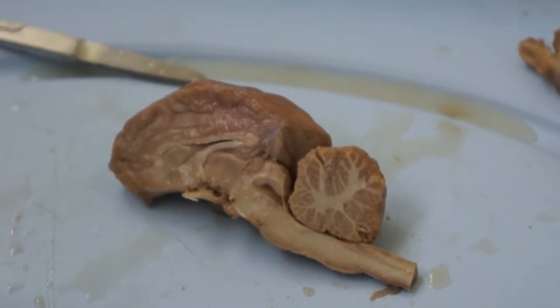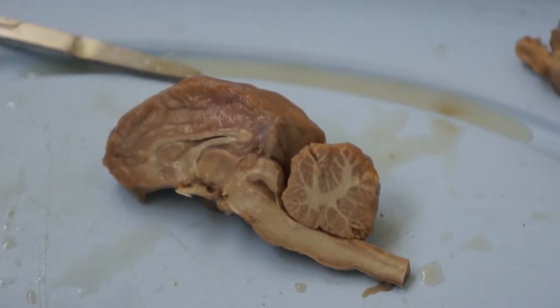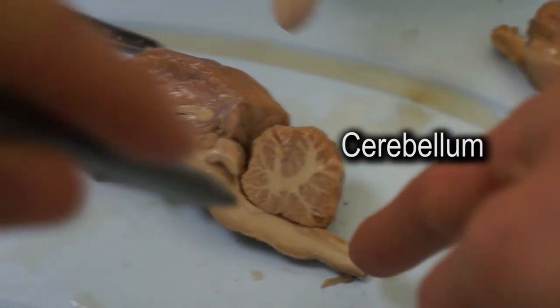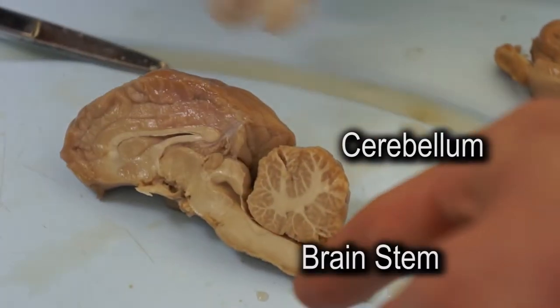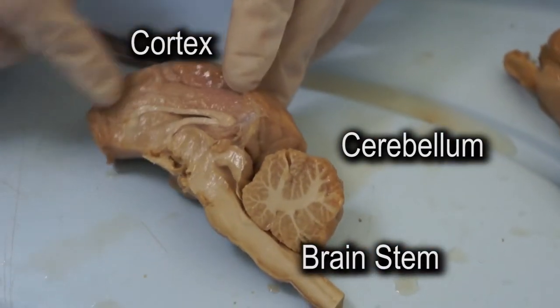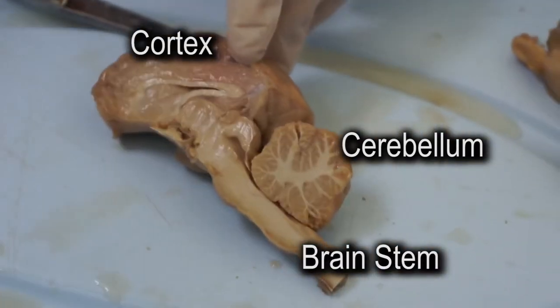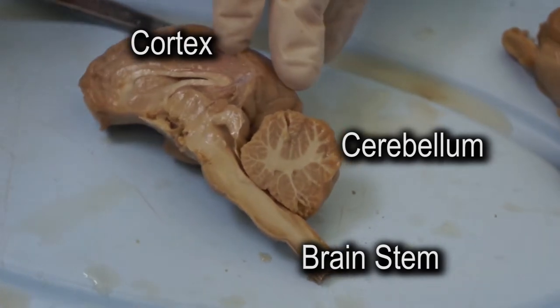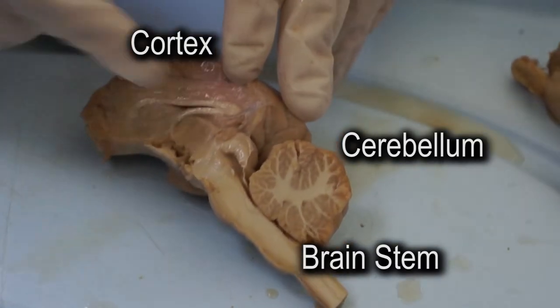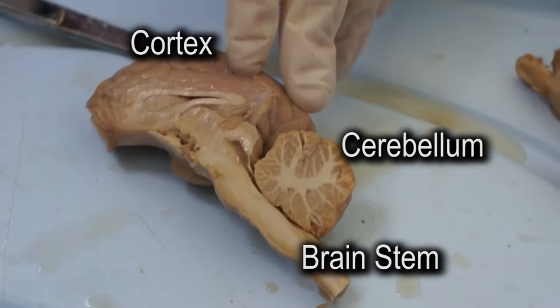The branching structure inside the cerebellum — that's so cool. Cerebellum, brainstem, telencephalon. This is the cortex where you have the neuron bodies, and everything that is more white is like the axons.